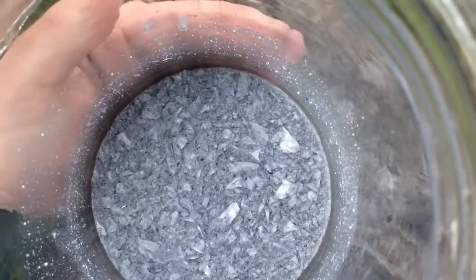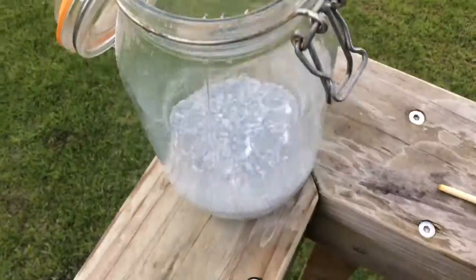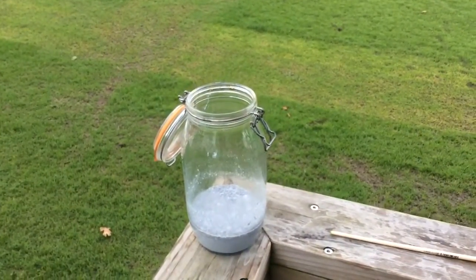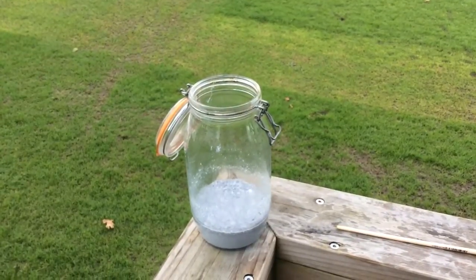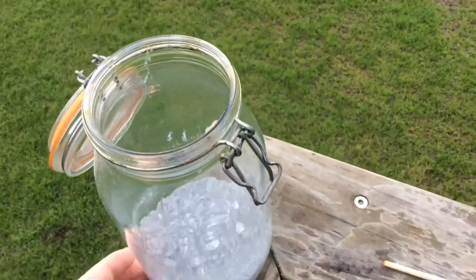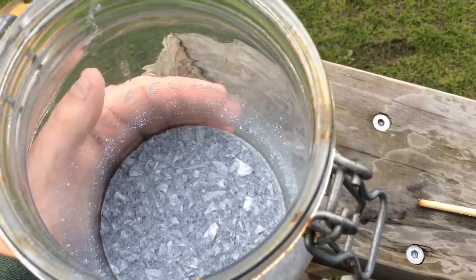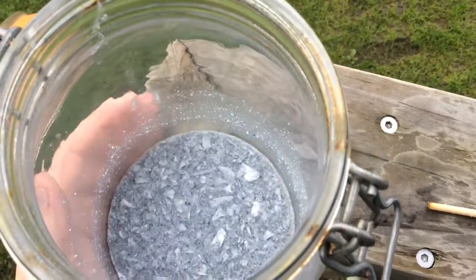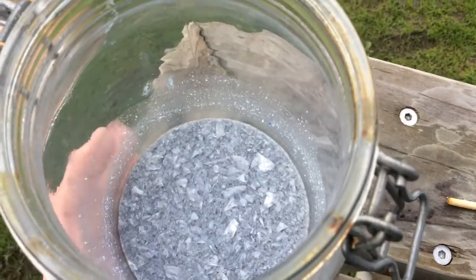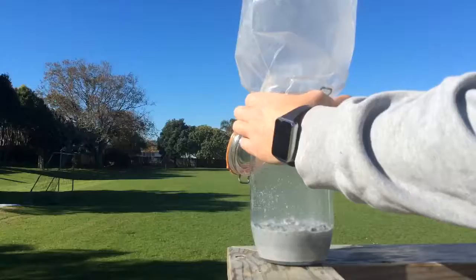Now it is exothermic, it's warm to the touch, but it's not hot, which means that it's not giving off any steam. So if I back out, there's no steam coming off there, but just to show you that effect, I'll edit in the video that I did yesterday that shows the steam coming off. So that's quite disappointing in and of itself, and I think that has a lot to do with today being a bit colder than yesterday, so this glass jar, not being very insulated, is not able to get hot enough to produce steam, but it is warm to the touch.